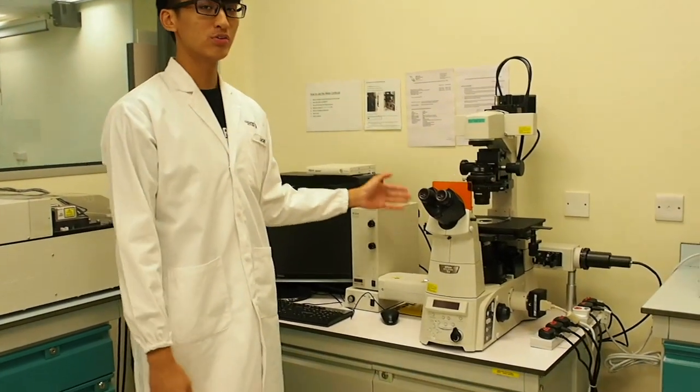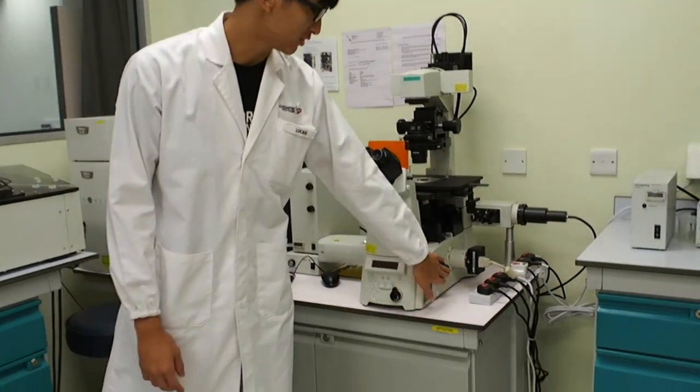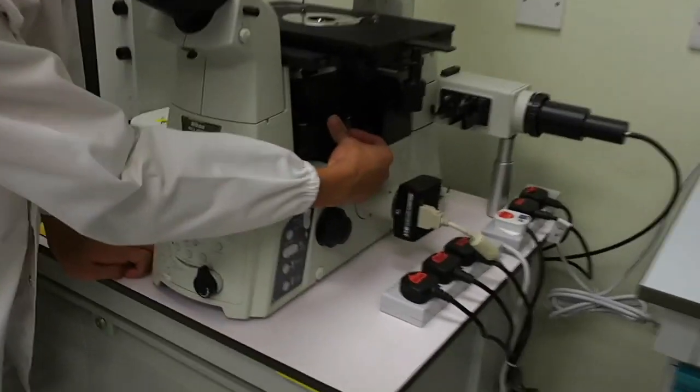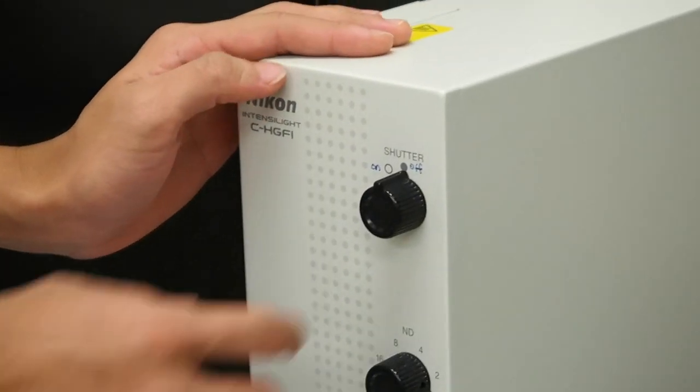Focus on the sample using the fluorescent microscope first. Step 10. Turn the coarse adjustment knob accordingly to locate the cells. Always remember to use the coarse adjustment knob first before using the fine adjustment knob. Once the sample is in focus, turn the filter to empty. Step 12. Turn the shutter off for the fluorescence microscope.